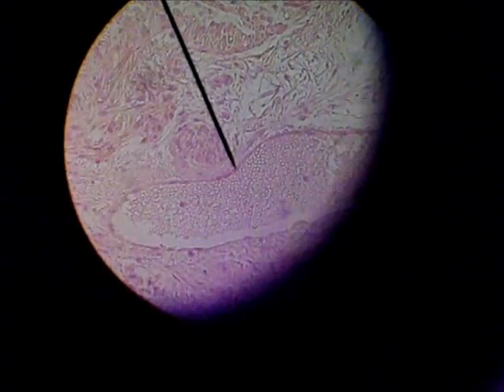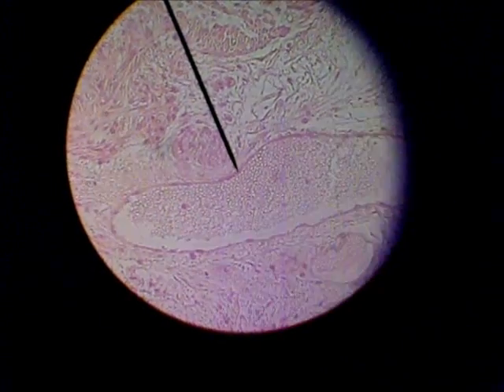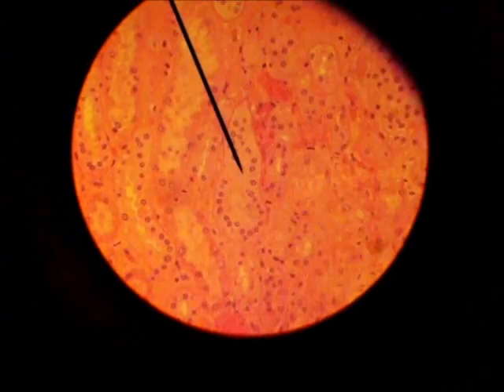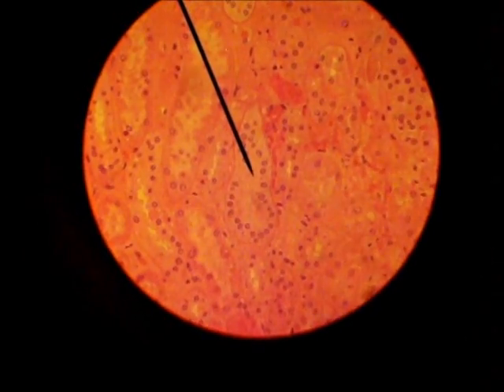Ciliated pseudostratified columnar epithelium. That was ciliated pseudostratified columnar epithelium. Transitional epithelium, which is found in the urinary bladder. Simple cuboidal epithelial tissue.